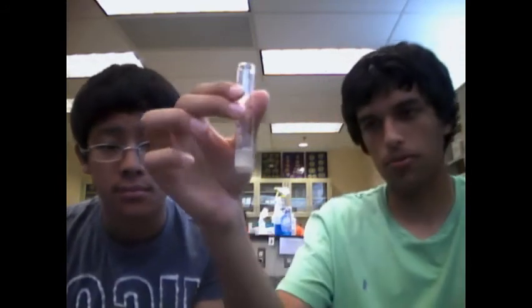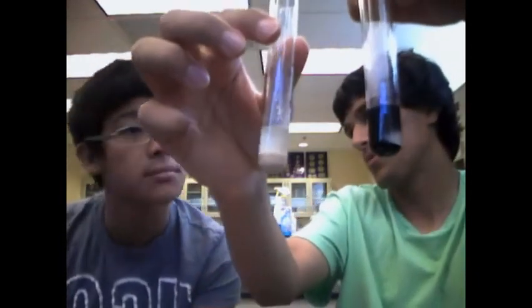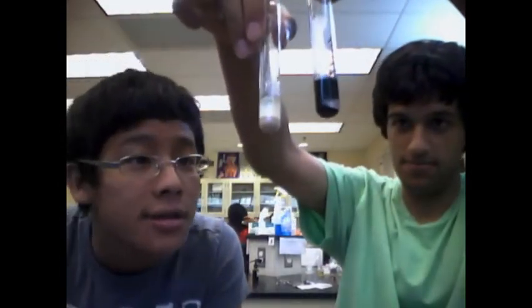Finally, we come to unknown substance number 4. Professor Philip, your verdict? We have no starch. No starch. Negative test.